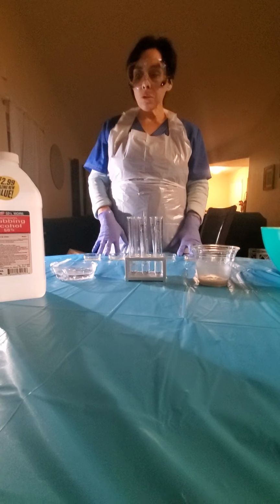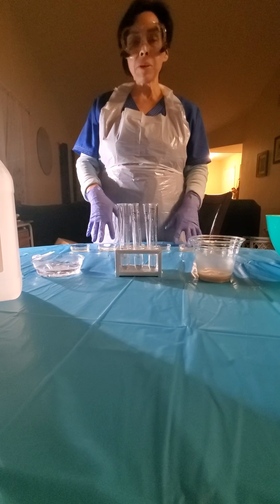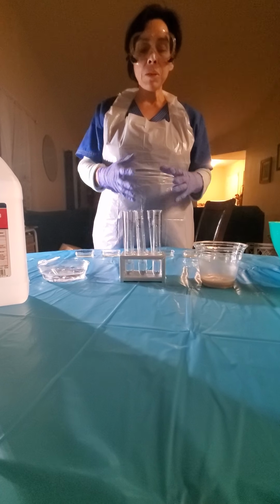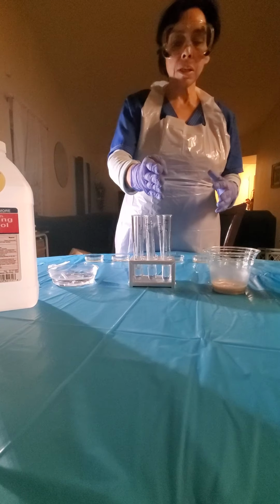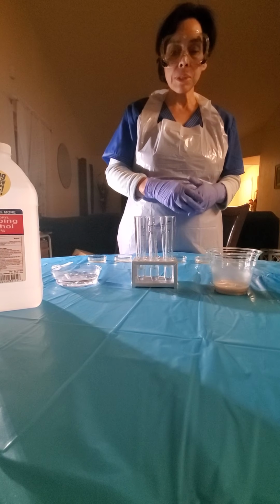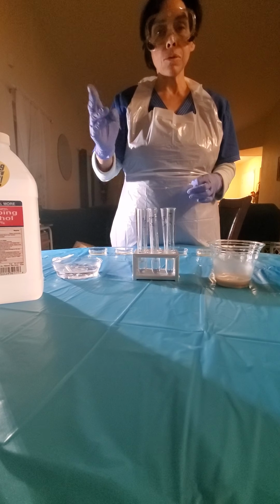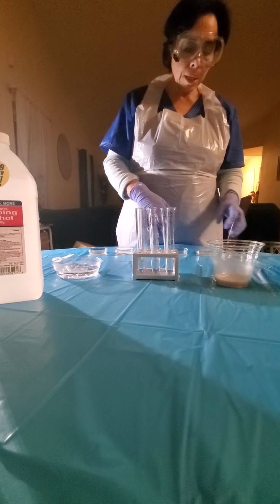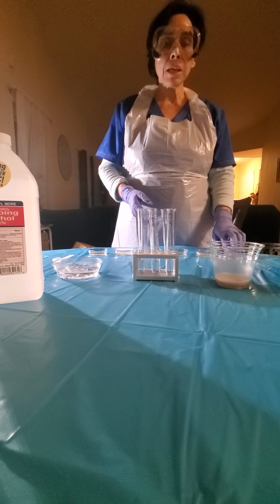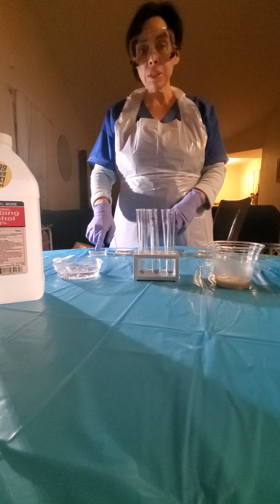This is week 2, and in this particular experiment we're doing the bacterial enumeration dilution. The goal is that we will begin to dilute the bacteria grown in the tubes. We have 6 tubes marked from 10^-1, 10^-2, 10^-3, all the way to 10^-6, and we also have our agar plates, which are labeled with the same numbers, 10^-1, 10^-2, 10^-3, all the way to 10^-6.